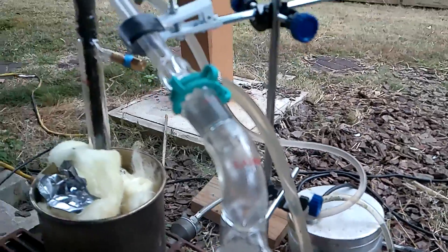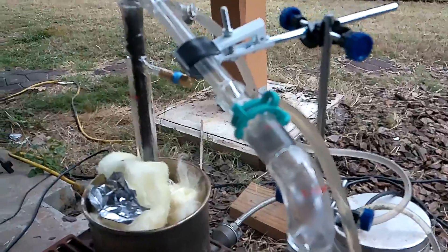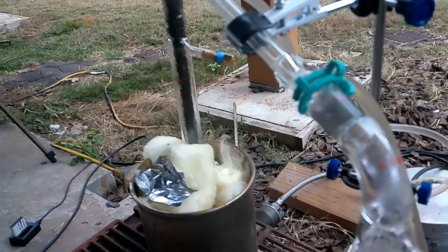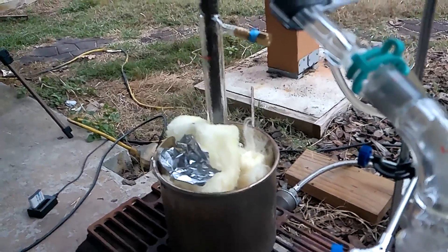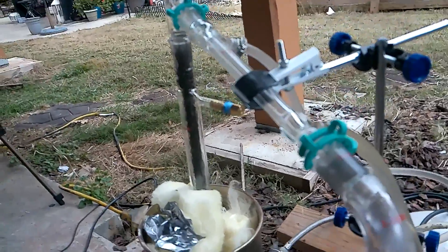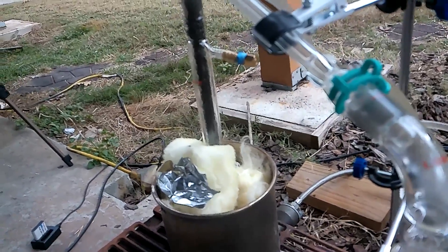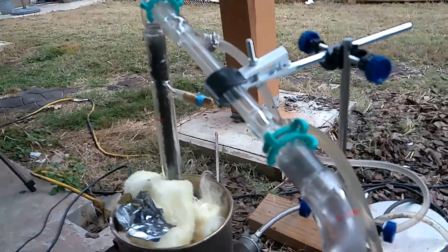The main reason I bumped it up so much is because I only have an hour left to run this thing before I need to go somewhere, and I am not leaving an open flame when I'm gone. Unfortunately, this run is going to be cut short today — I'll do another run tomorrow. With distillation, it's not as simple as just doing another run; you pretty much have to completely restart when you shut it down. That's unfortunate, but that's how life is.